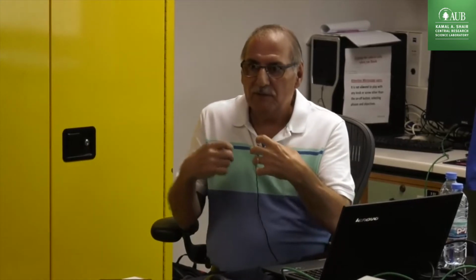The first point was too high. But if we took 0.001, we'd get 5 points before this. If we took 0.00001, we get 10 points. But of course, if you go low, dosing is going to take much longer time, because we have 10 more points, and especially at the very low end, it's a very small amount of gas, down to 10 to minus 4. The system may open and dose too much gas, and has to take all the gas out and adjust the pressure. So it takes some time. So don't be upset if you have more points here.